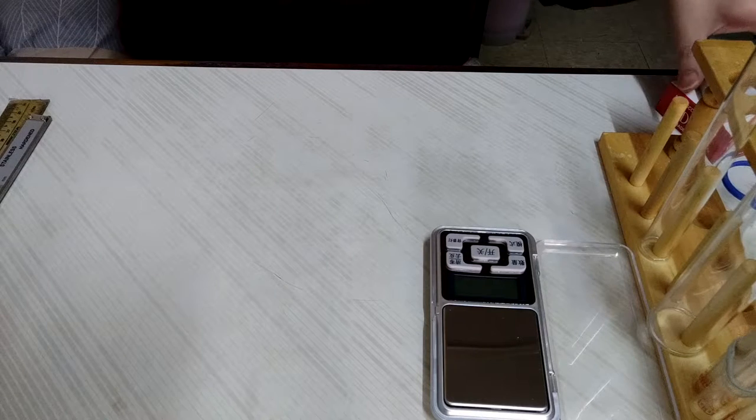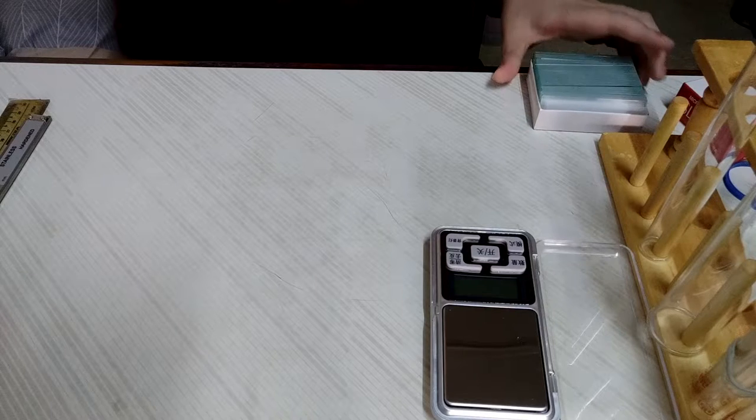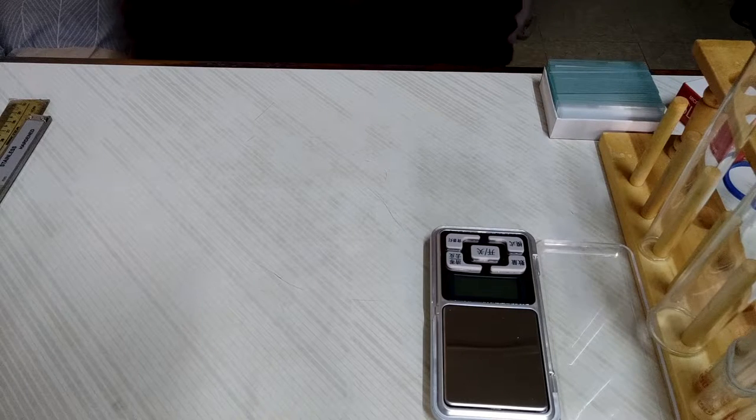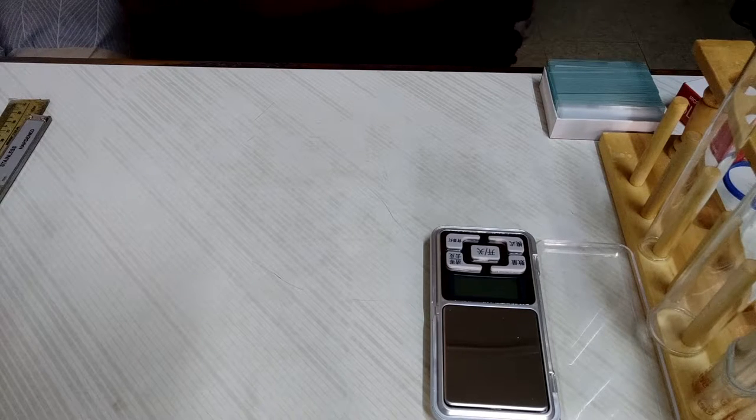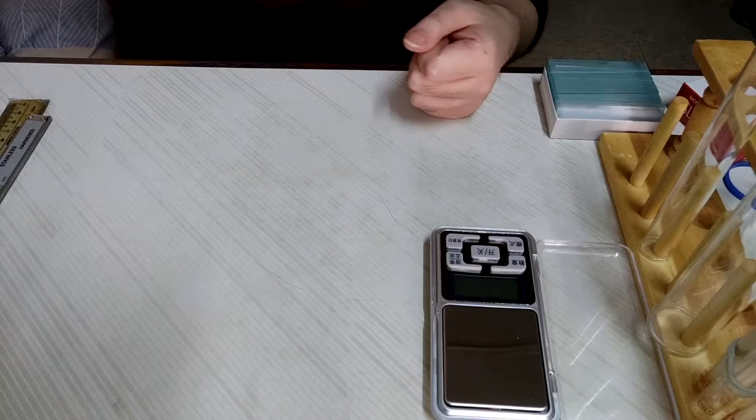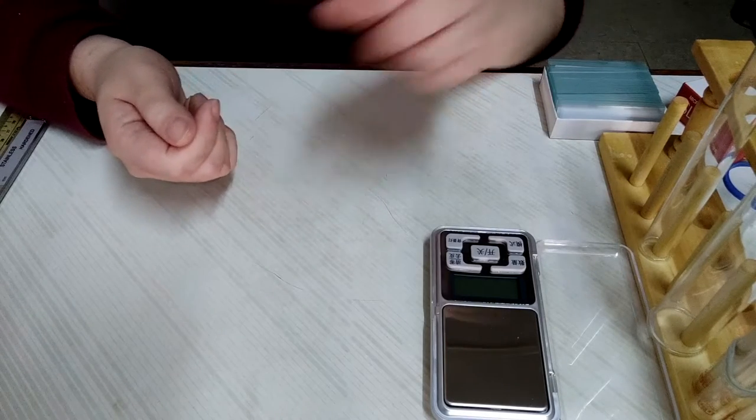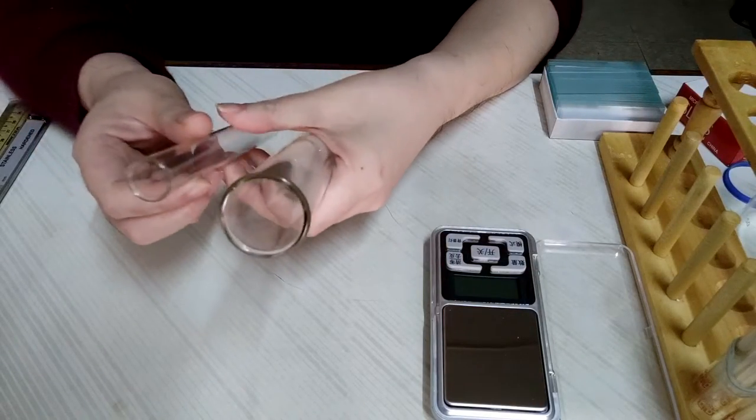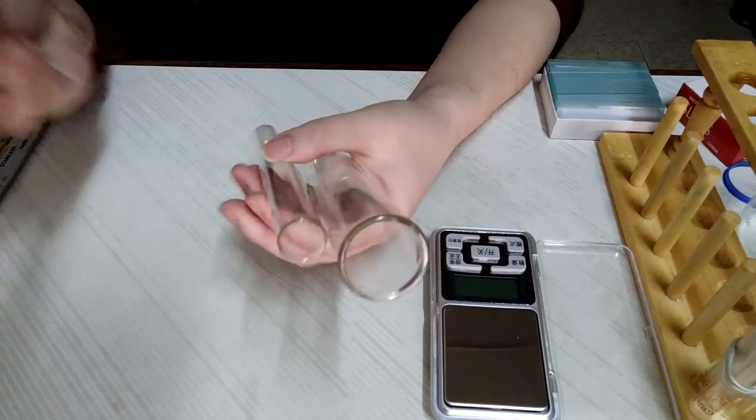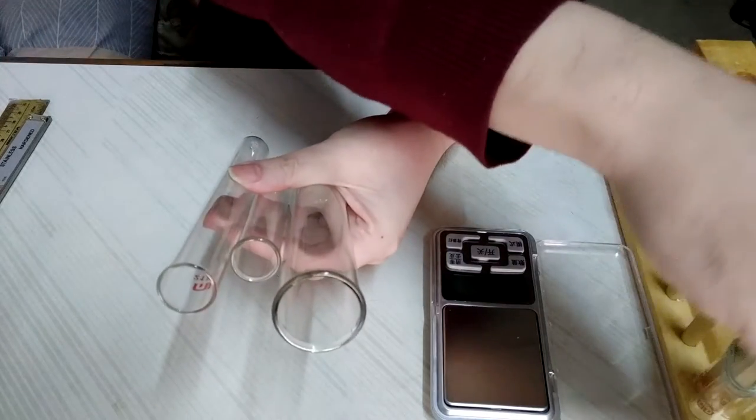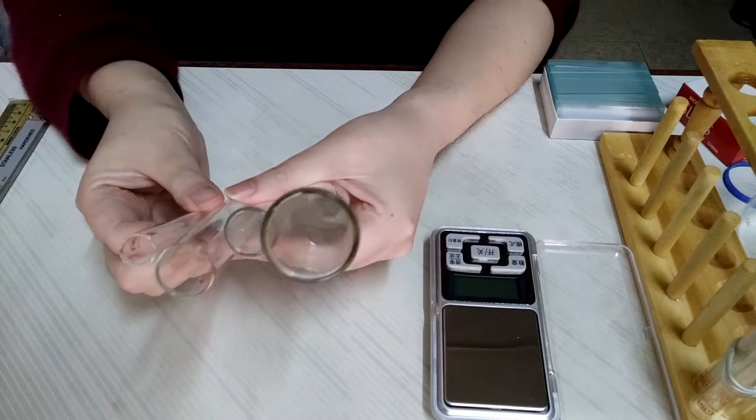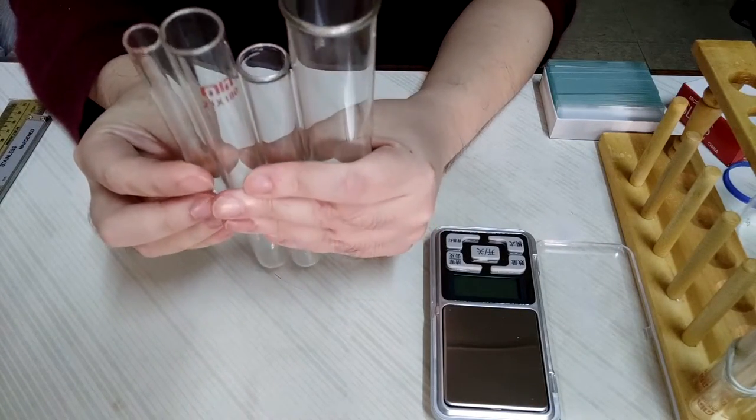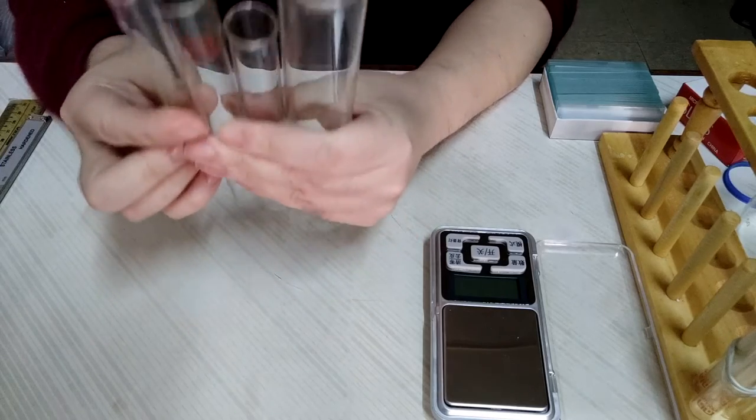I hope you will be amazed by the discovery from this video. So, I am going to conduct a series of simple experiments to find out the common capacity and dimensions of glassware, like different size of typical and extreme size of test tubes.